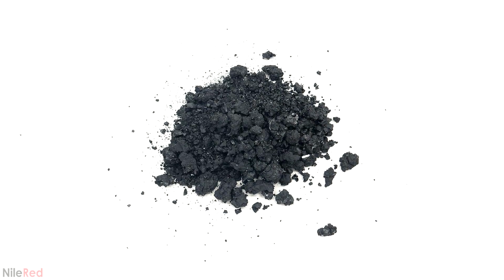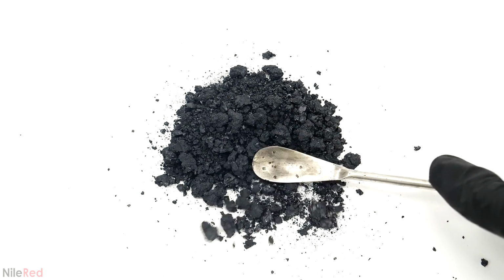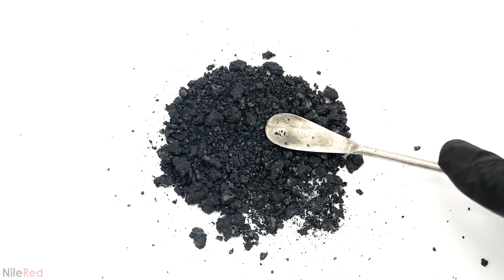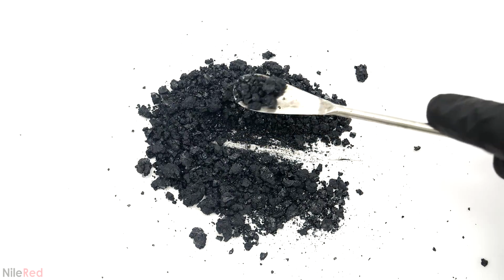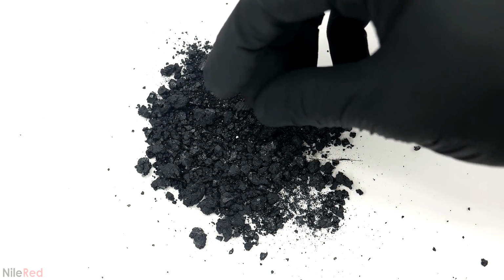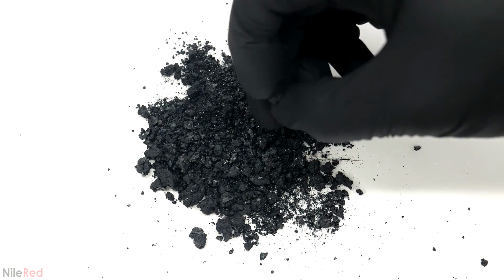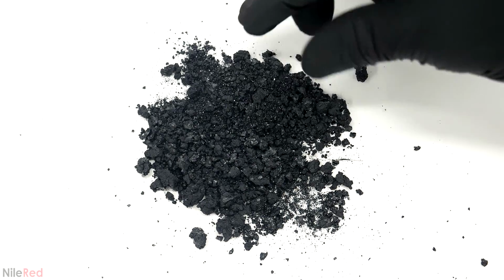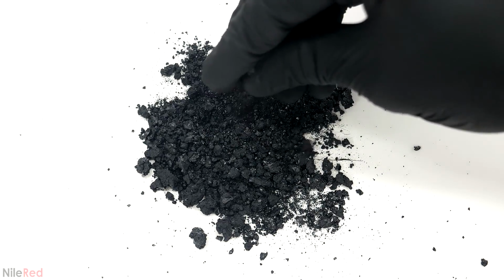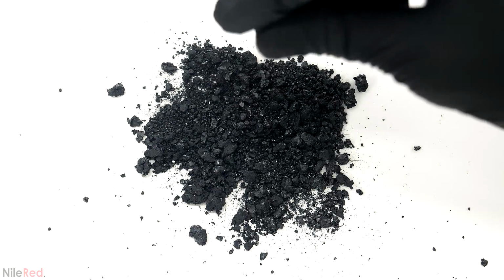When I first started making ferrofluids, I assumed that the magnetite at this point was going to be really oily and gross. However, it wasn't like that at all, and it was just a regular dry powder. The larger pieces looked really solid, but they were actually really easy to just break apart with my fingers and crumble them into a dust. One thing to be careful with though was that these were nanoparticles, so it was important not to breathe any of it in. But anyway, I had now successfully made the ferro part of the ferrofluid, and the next step was to add the liquid.